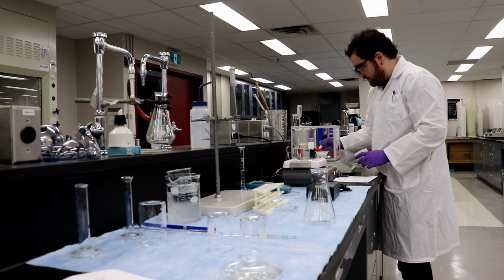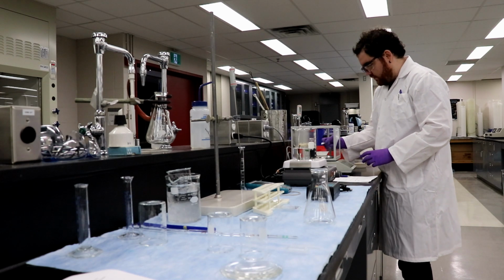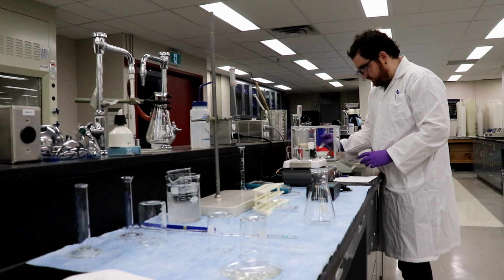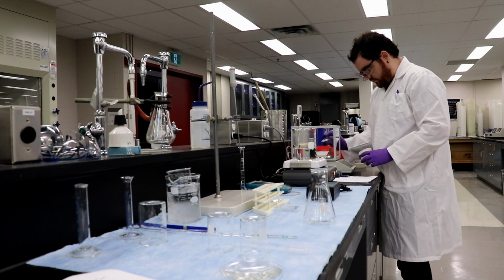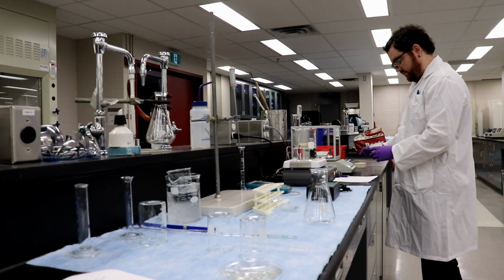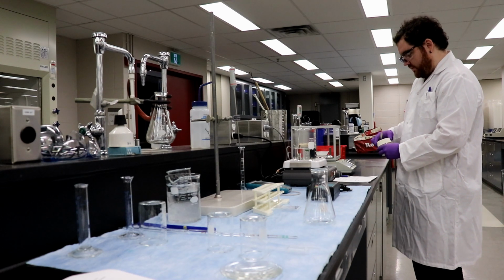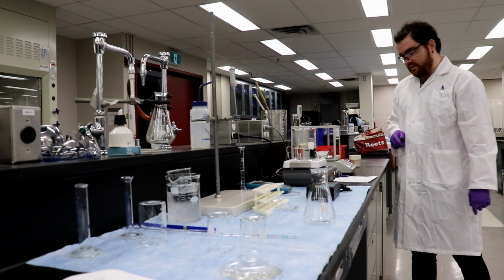4.7, 4.3, almost there. I can go a little bit more. When I was an undergrad, we had a game, get as close to the weight as possible. Okay, Ingrid, and this is 5.0000 grams. I nailed it. No way. Take a look.